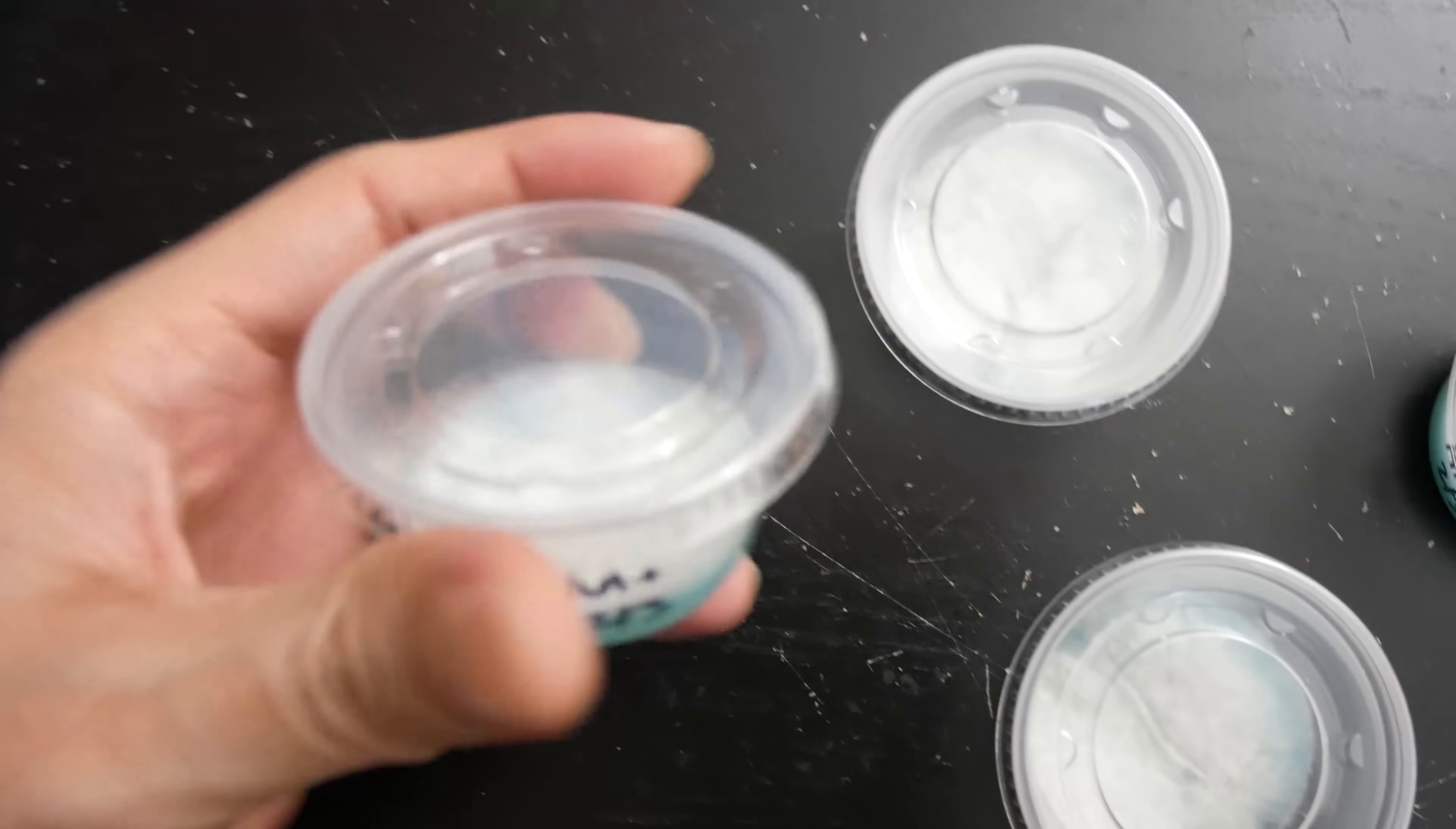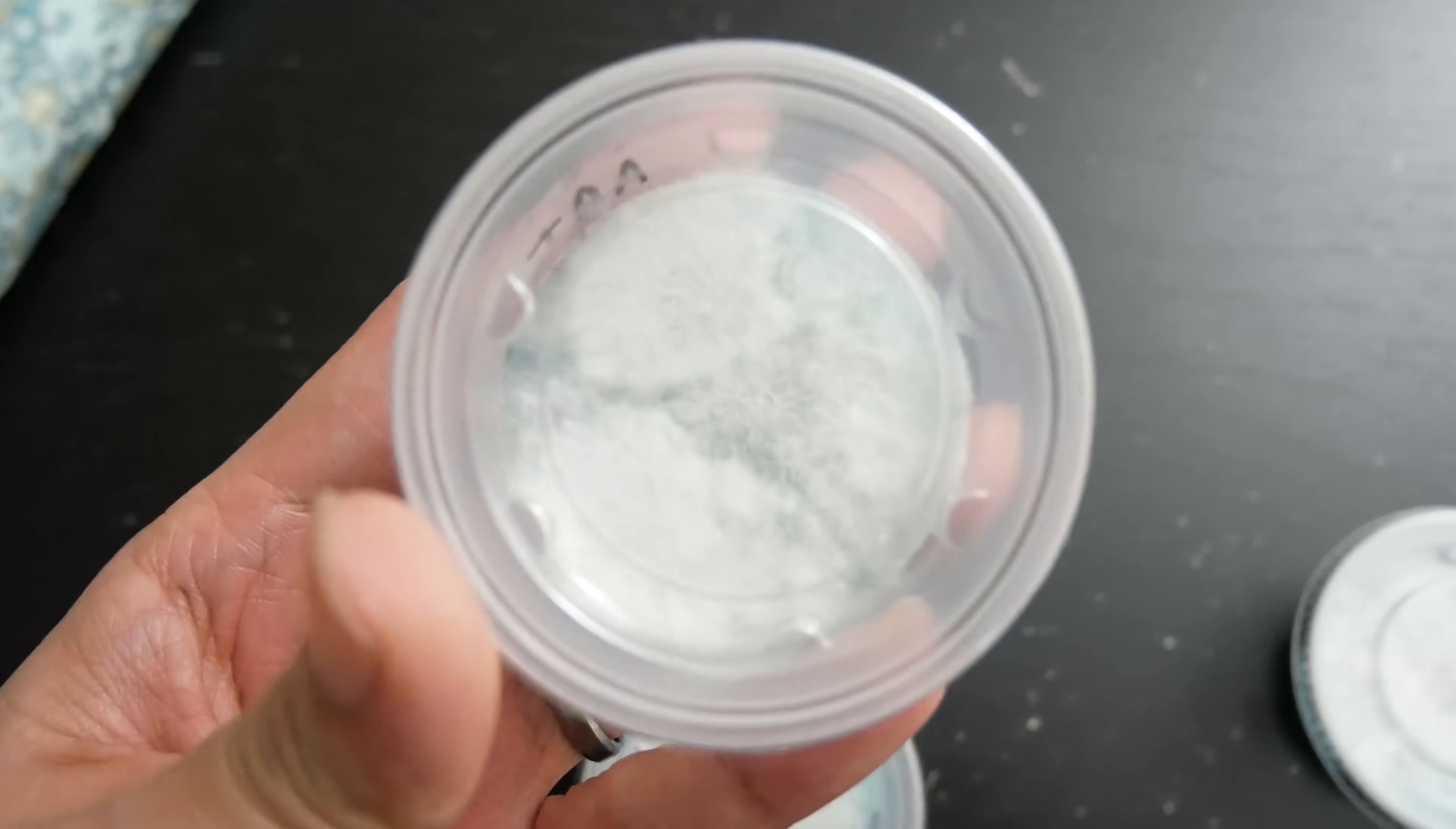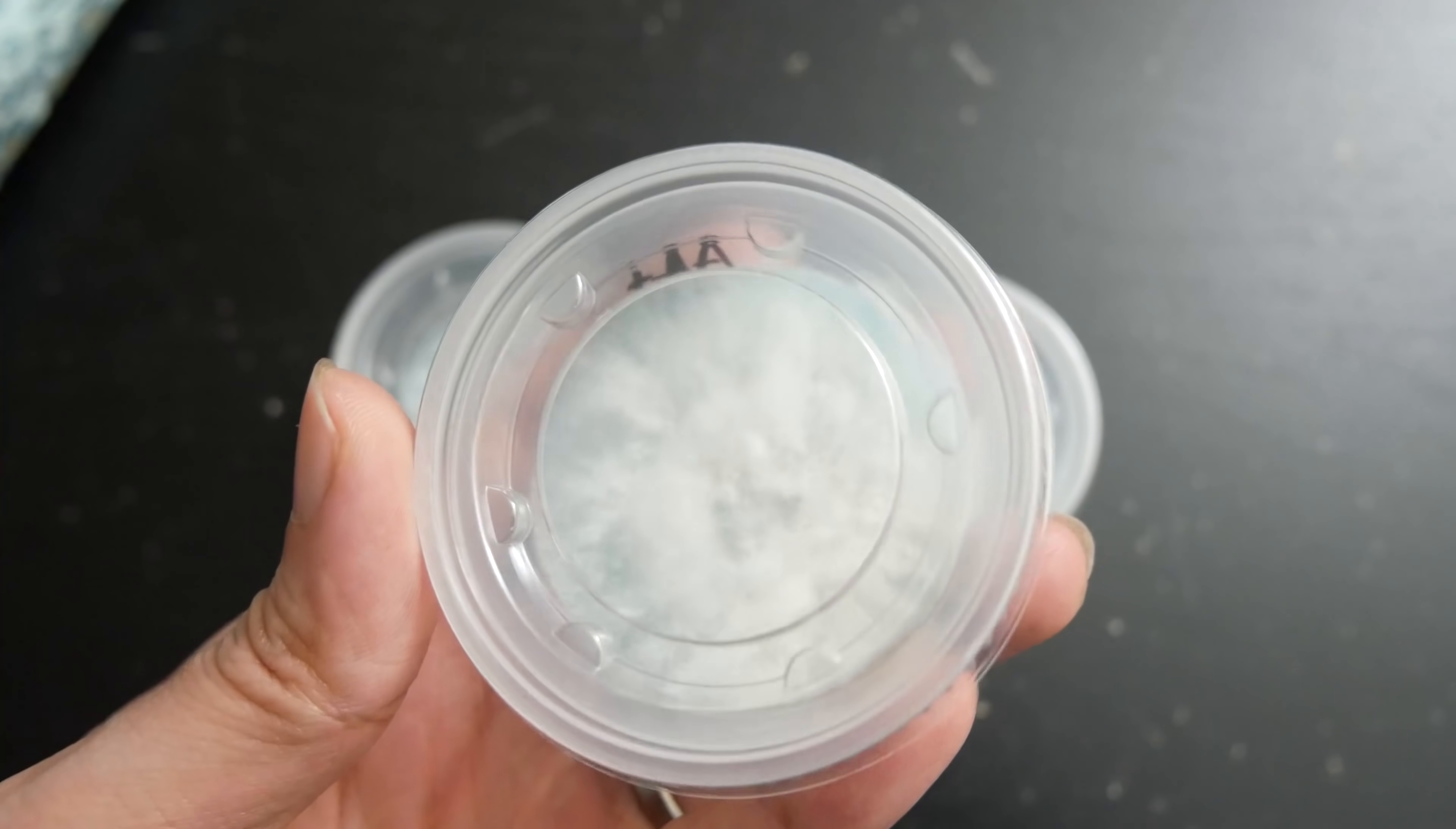So much much later. I've left the dishes out for a bit longer here. It is on day 22 after inoculation. The spores have germinated fully and mycelium has pretty much covered the entire top of our agar dish. At this point you can start making transfers out of these onto new dishes. Let them colonize, make sure you have a clean culture, and once they're ready to go you can inoculate them to your grains. So that's pretty much it for spore swabs.